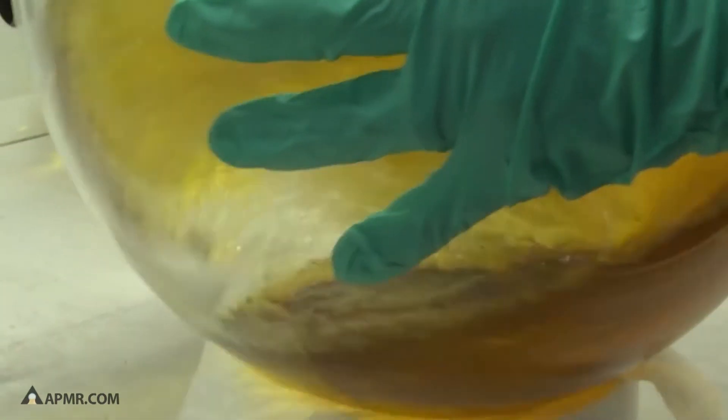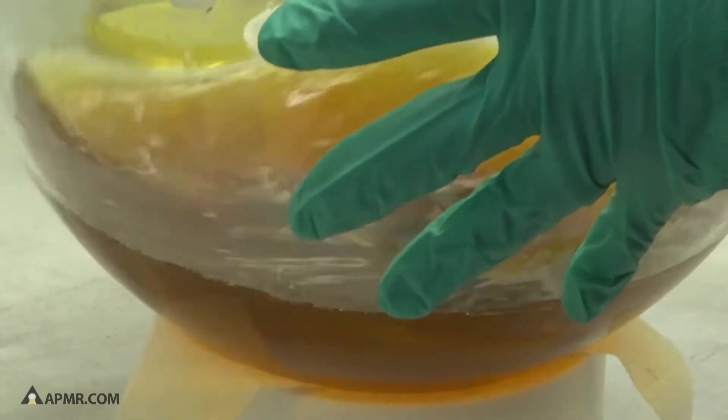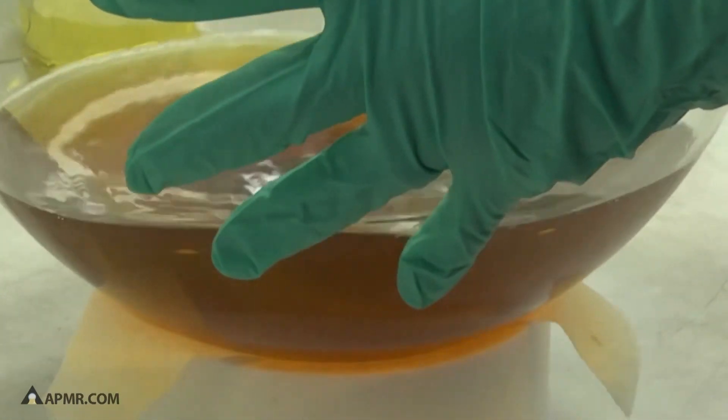Basically what he's doing is making sure that all of that shot, all of the metal, is coming in contact with acid. He'll do that periodically throughout the digestion process.